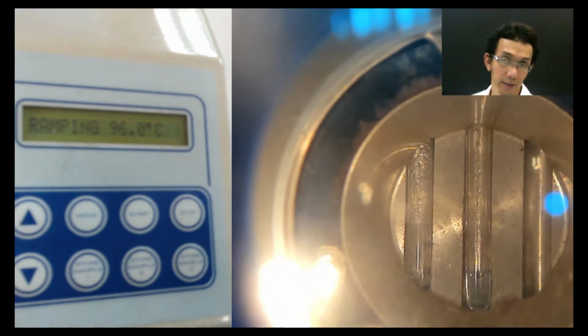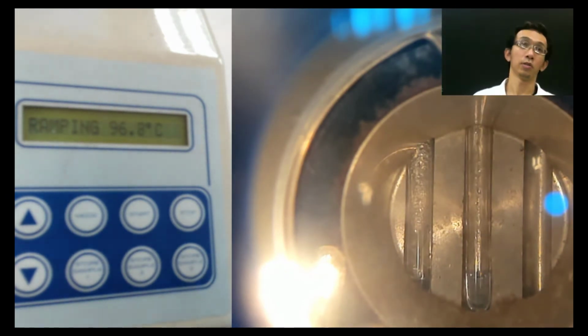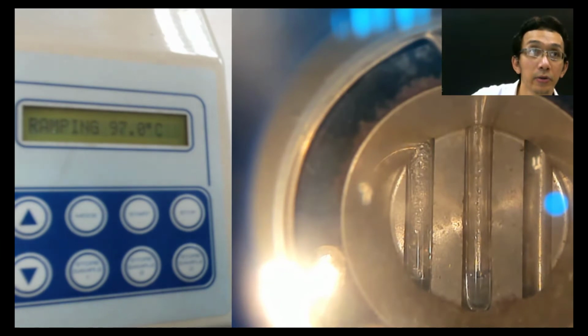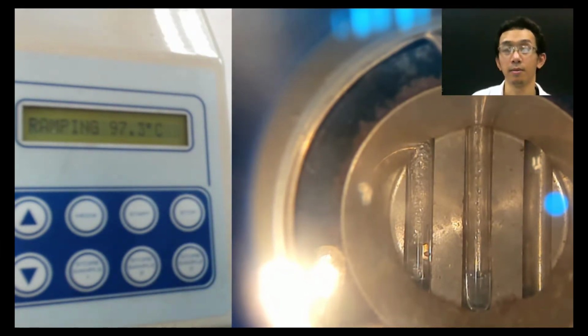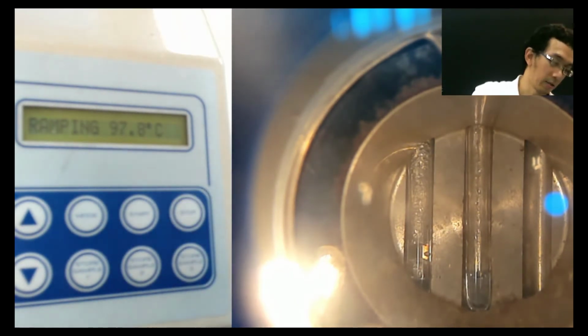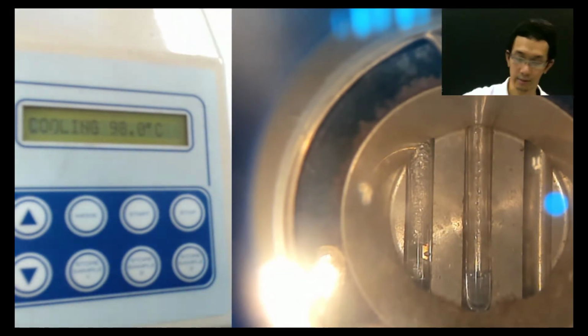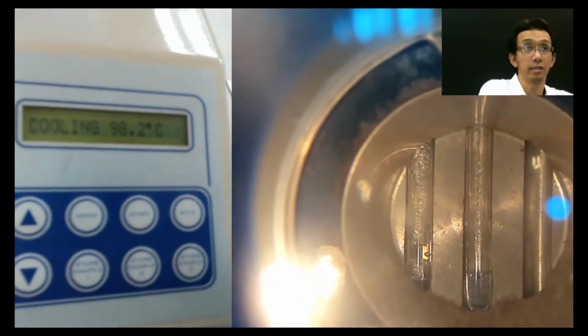Sir, okay, name. This is Nur Sarah. Sarah, yes. Why is it from group 3? Group 3. Okay, so we basically are done. Both of it are already melted. So now I can stop this thing. Stop. Okay, now I rearrange this thing.